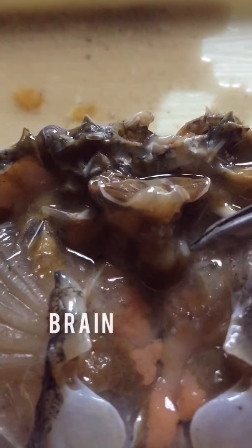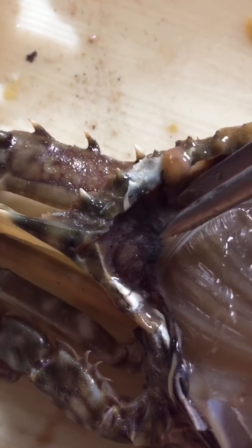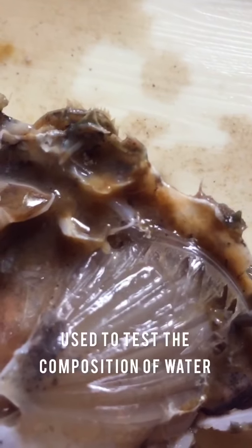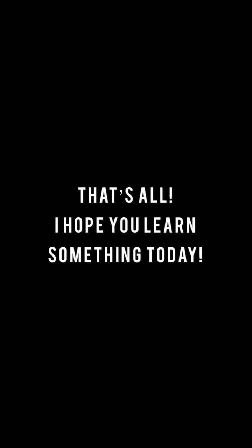Crabs have a brain too. The brain helps the crab understand what it is seeing. This here is the hepatopancreas, which is for absorption and storage of nutrients. And lastly, there is the crab's flagellum, which is used to test the composition of the water passing through the gill chamber.